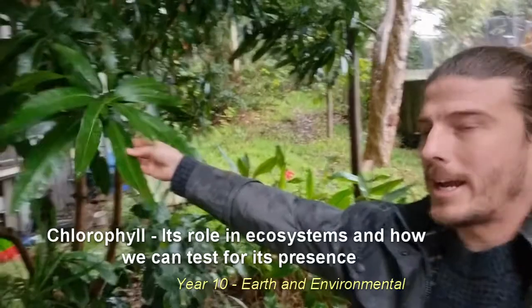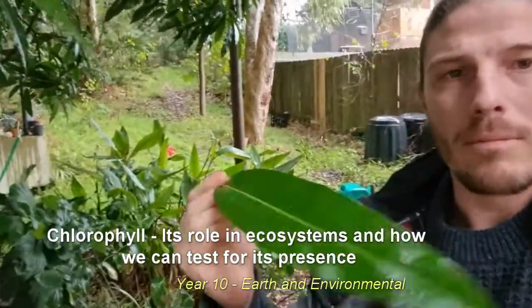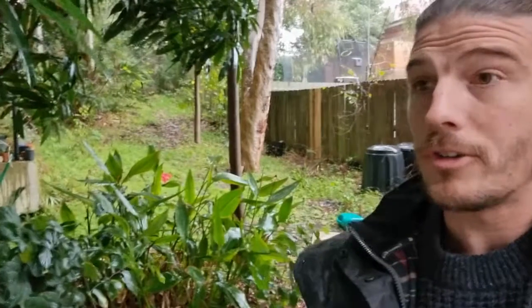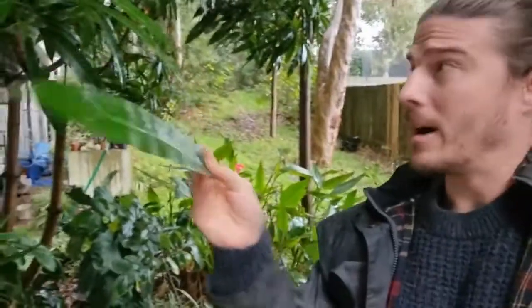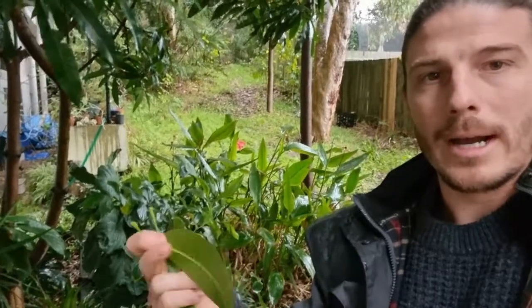We're going to test the chlorophyll content, plus see whether there are any other pigments in that leaf using chromatography. And we're also going to test the mango leaves for substances such as starch and also sugar.